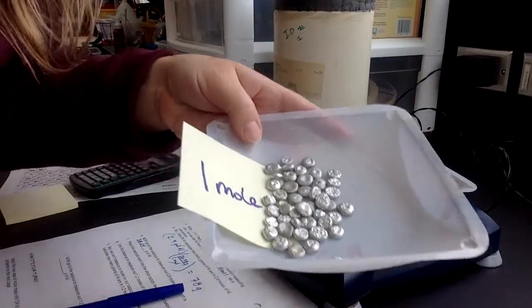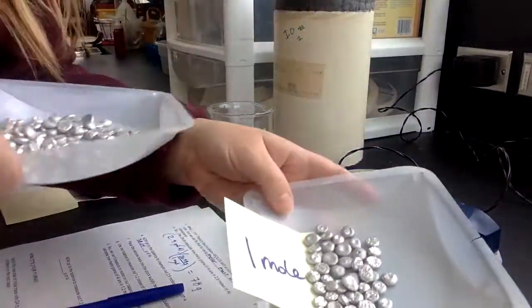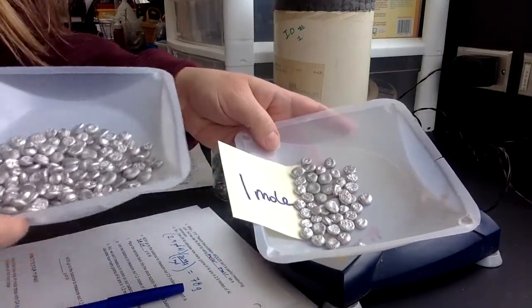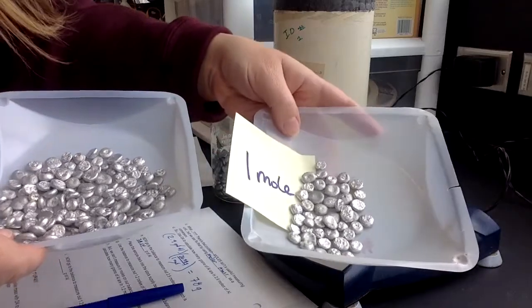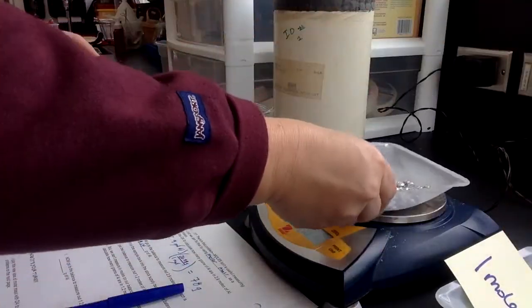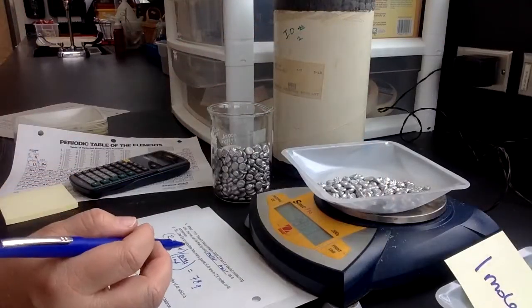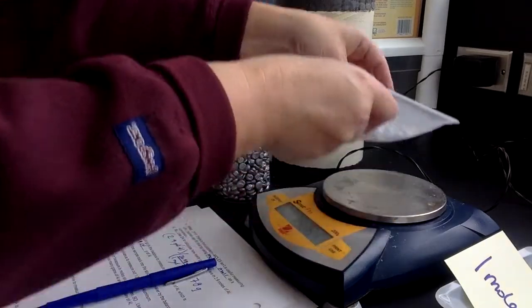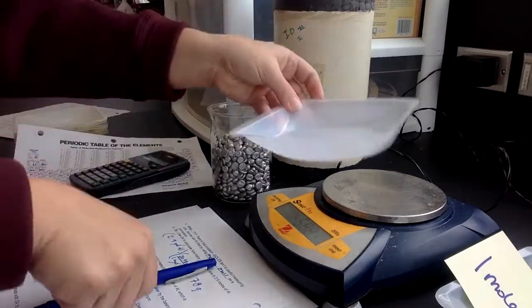All right, now look at this sample. Remember, this is what 1 mole looked like. Now look at this. This is so much more. Well, that makes sense because remember, this was 2.9 moles and this is only 1 mole. So kind of giving you that visual of what do these numbers really mean. And then the last one it asks me is, it says I can get rid of this sample. So put the sample back in the beaker. And now I'm on letter G.